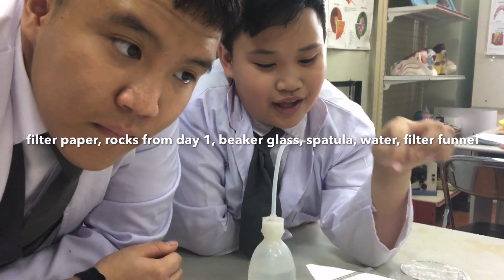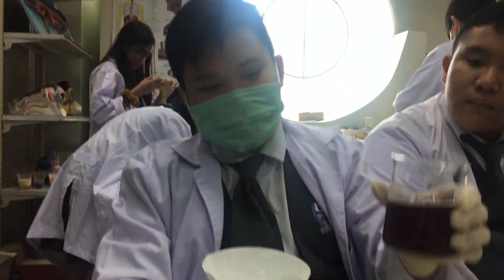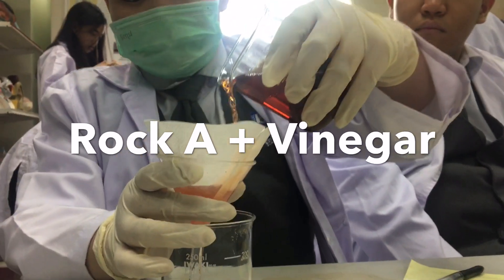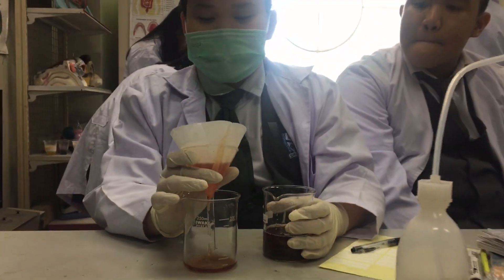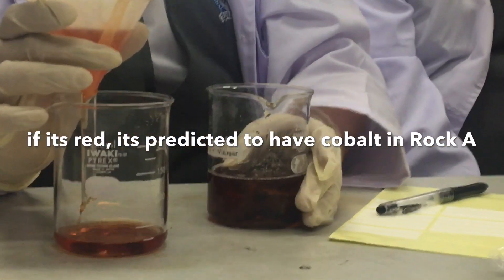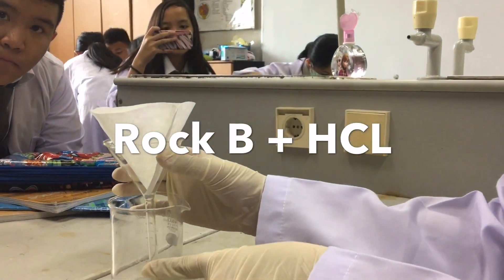What we're going to do is pour this through the filter paper. We're going to take the rock and also take the minerals and observe it to see the shape, the color, and what's in it. Now we're going to filter rock A. It's like blood, or Gatorade or something. If it's red, Miss Mehta said it's cobalt. That means the minerals from this sample are very much cobalt.